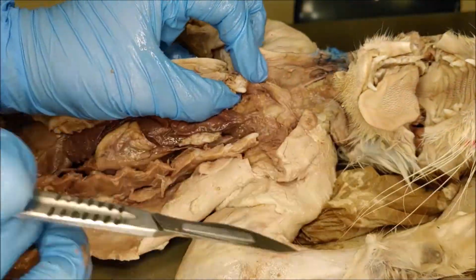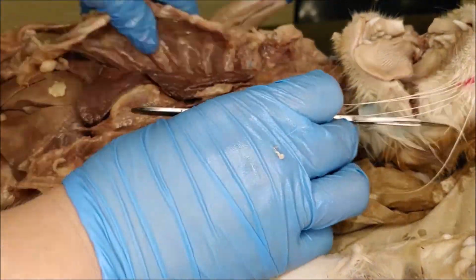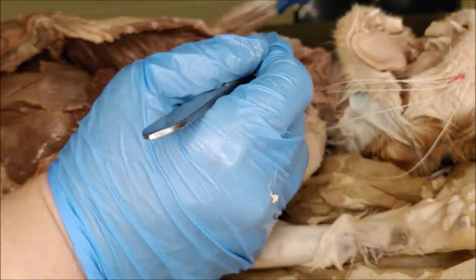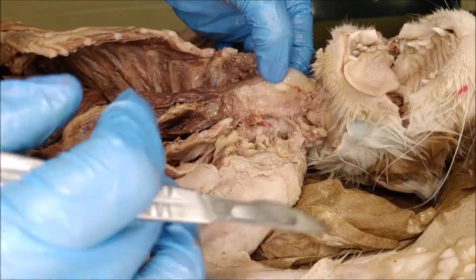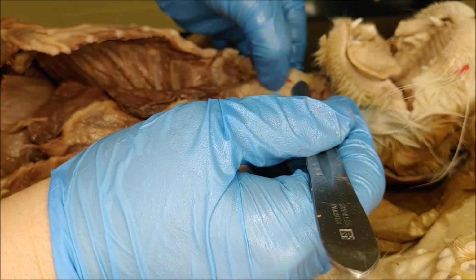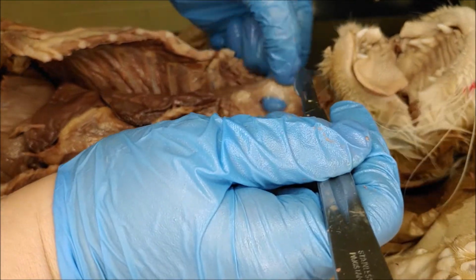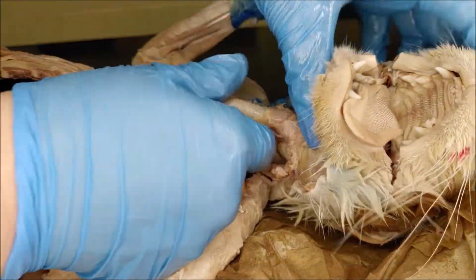And finally, we're going to find the epiglottis and the glottis. First, we need to remove the musculature that's lying on top of the trachea so that we can pull that up and actually look down into it. If you did break the jaw well enough and opened the mouth really far, you could potentially look down and see the epiglottis, but we're going to find the trachea right here. It's got these rings of cartilage that give it structure to keep it nice and open for breathing. All I'm doing right here is just making a little notch to make it easier to see the difference between where the trachea and the esophagus is later on, so don't worry about that.